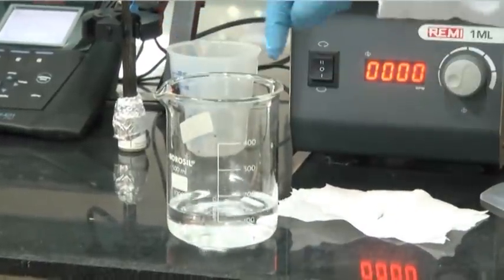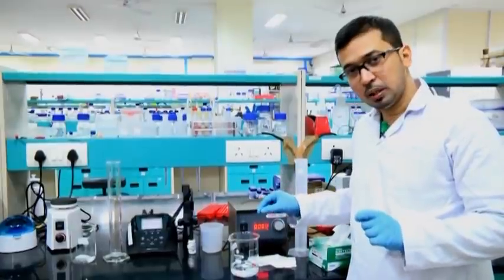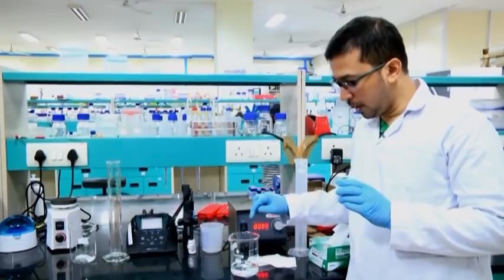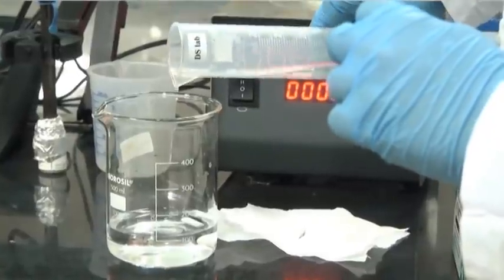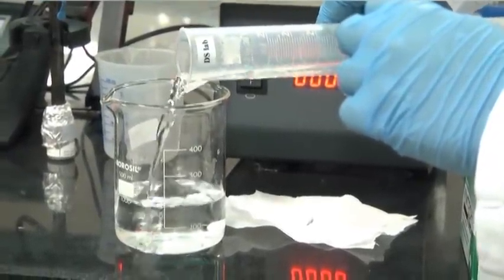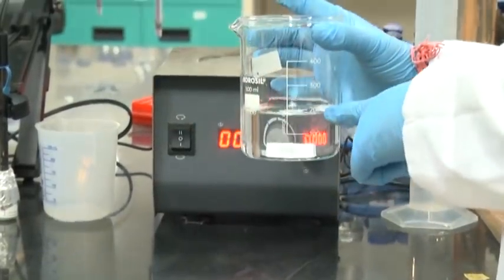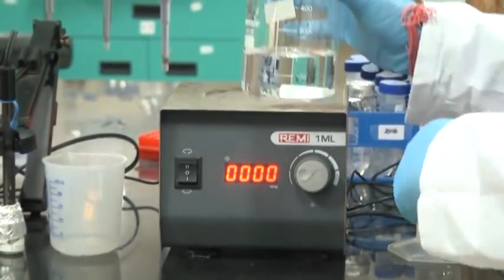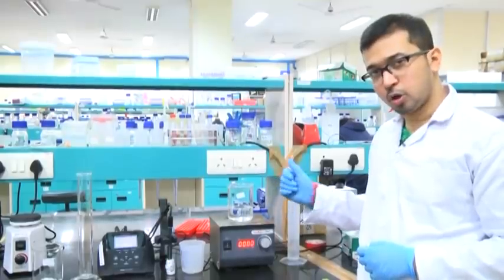I have added this without using my hand — I have just rubbed it using the tissue paper and directly from the tissue paper added it into the solution. Now I am pouring again double distilled water up to roughly 200 ml. So here we have poured around 200 ml of double distilled water. Now I will keep it in the magnetic stirrer for dissolving of the solute components.